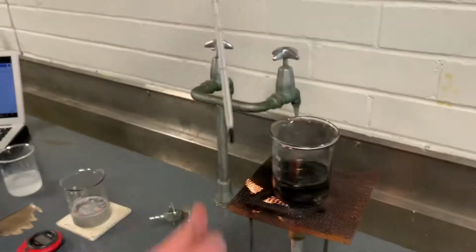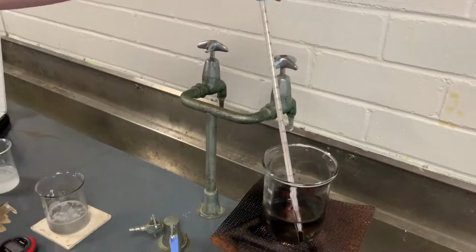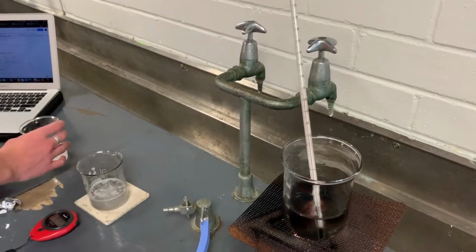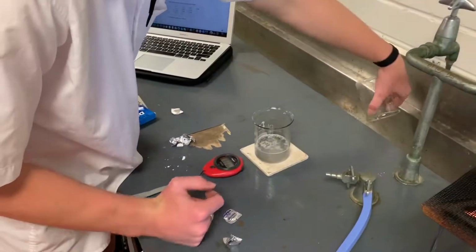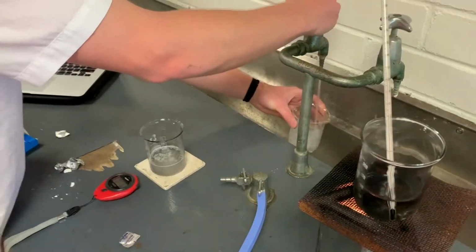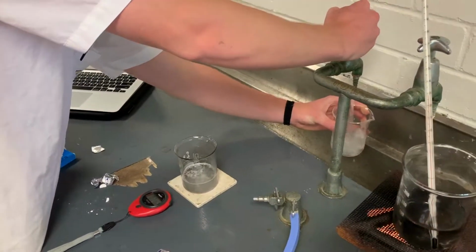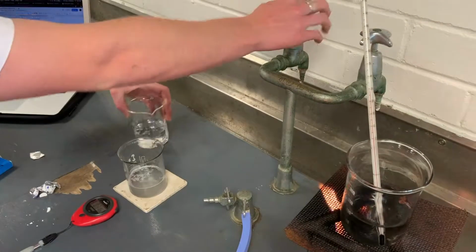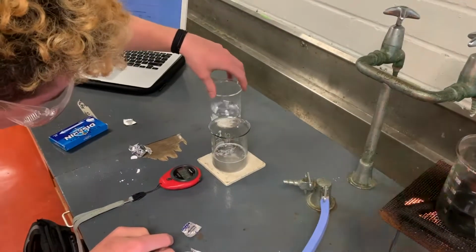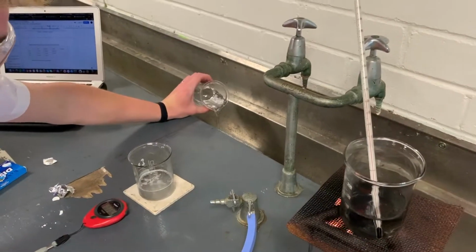Now that I am done using the thermometer for the other one, I will place it onto the beaker that is now being heated to 65 degrees so I can constantly check the temperature. I will also fill up a third and last beaker up to 100 milliliters so we can finish conducting our experiment.